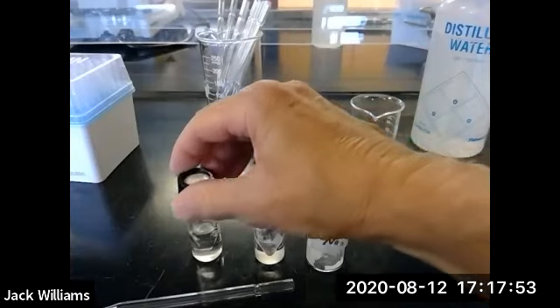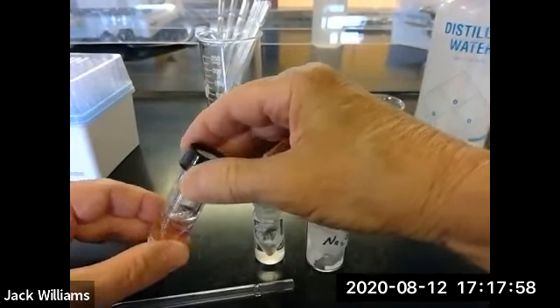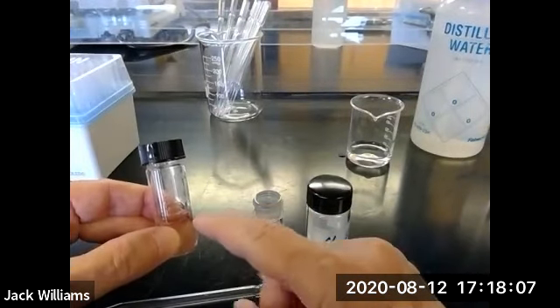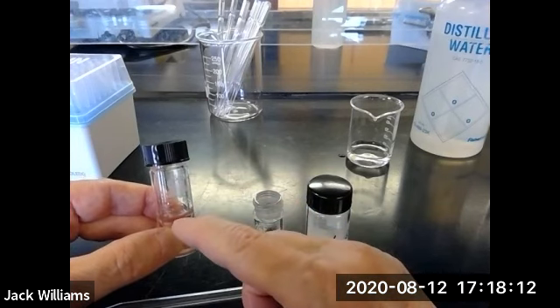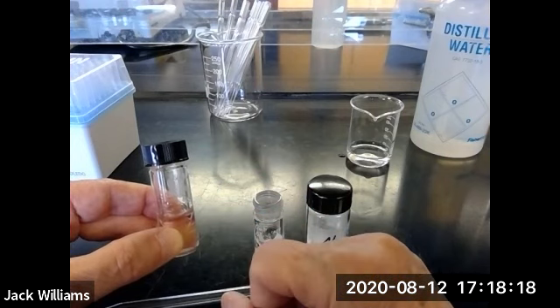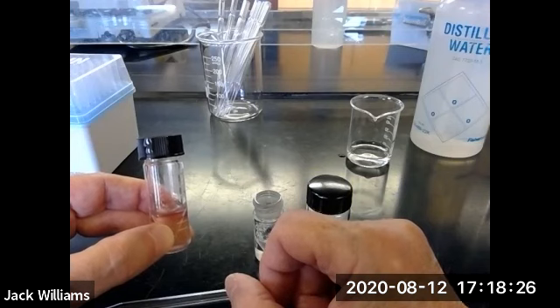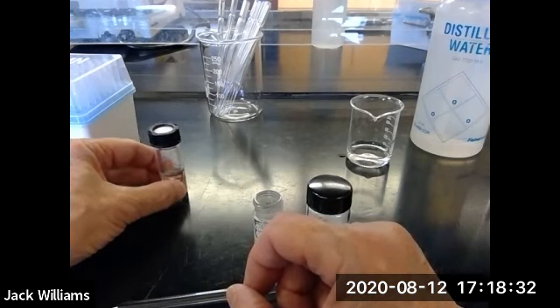Okay, so continuing on, we've got the water and benzoic acid and methylene dichloride in there, and we've shaken this a couple of times for a couple of minutes. And of course, the benzoic acid is distributing itself between the 2 layers. So depending on the solubility, there will be so much benzoic acid in the methylene dichloride, and there'll be another amount which will be present in the water. And the ratio of those 2 amounts is referred to as the distribution coefficient of benzoic acid in the methylene dichloride water system.